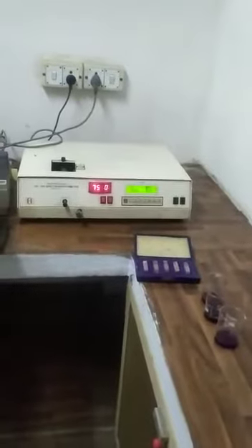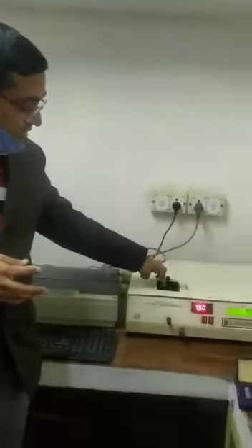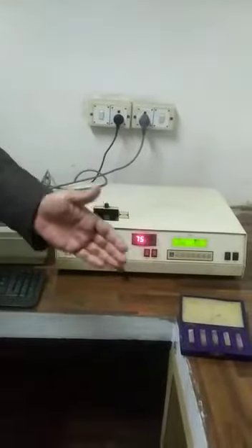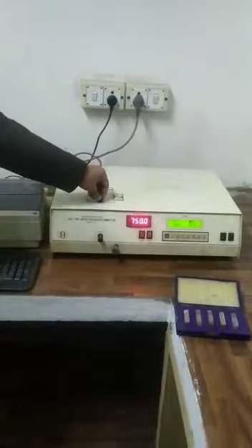Now look at that one — you have just prepared your solution sample. First will be your solvent. For example, if you are preparing KMnO4 in water, that water should be deionized, double distilled, or degassed water. Similarly, put your solution in all the tubes, place them in the slots, and shut down the lid.